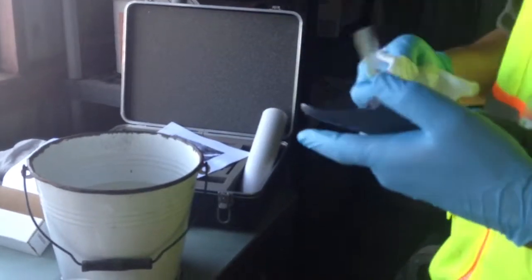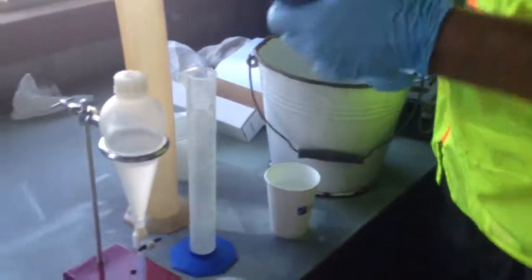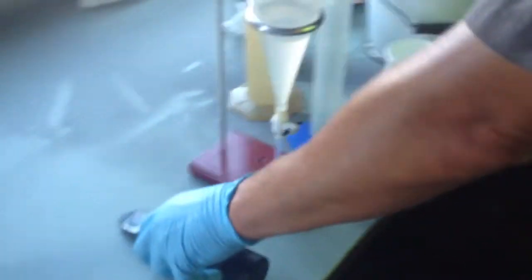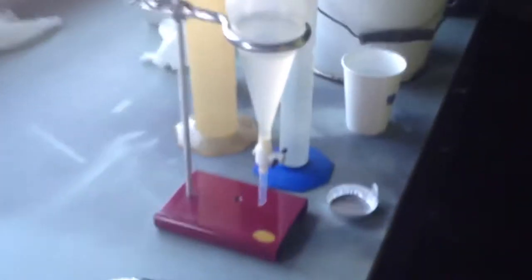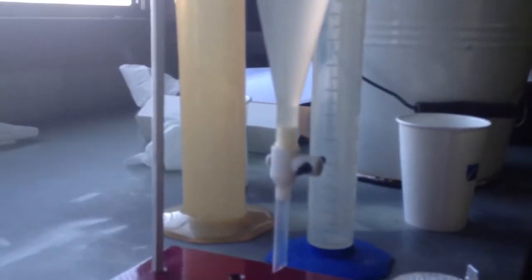All right. Our sample is settling. And then when we get that, we're going to go ahead and put that on here and we're going to look at the results. Still waiting. Settling nicely. We're going to stop now? Yes, sir.